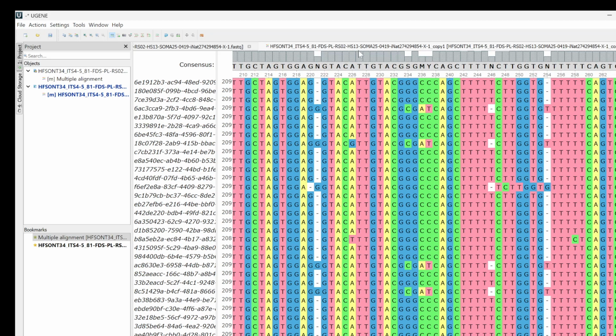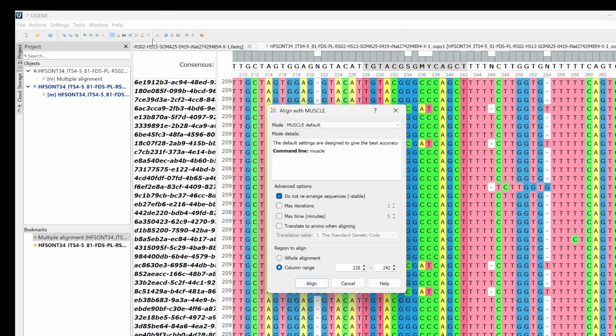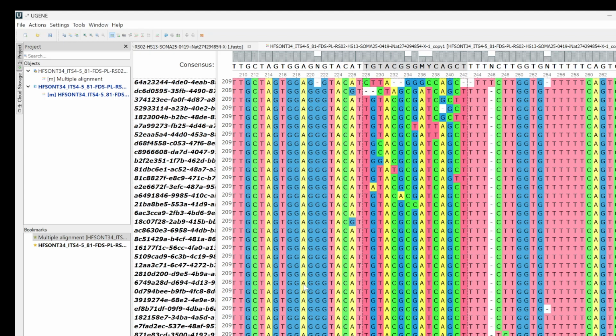One way that is good is to do MUSCLE. And so I'll just select some nucleotides and get a good bit of diversity on either end of the region that you want to align. And we're going to go into MUSCLE. The reason why we're using MUSCLE is only because it has this option here, do not rearrange sequences. And we want to unclick that. We want to rearrange the sequences, and we're selecting just this column range that we selected there. So we're just going to align the sequences based on the content of those columns.